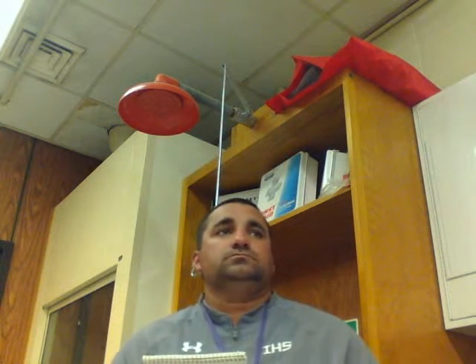Look, real quick, you're going to cut your letter out, and you're going to put it where do you think? On the slide. And then what are you going to do with the slide cover? You're going to cover it. Pretty easy, right? Alright, get to it. If you have questions, just raise your hand.